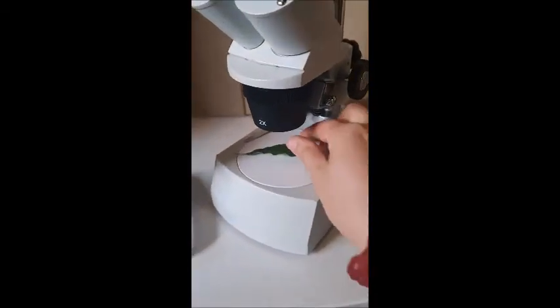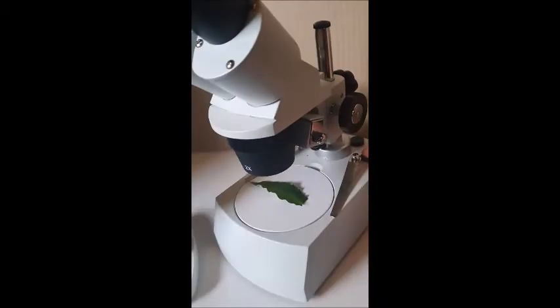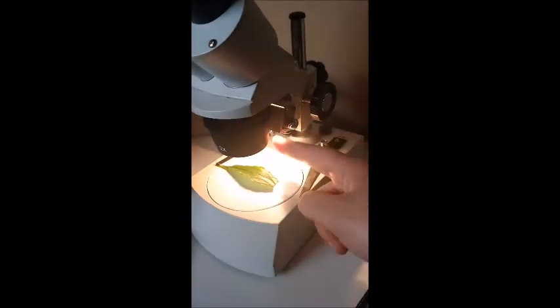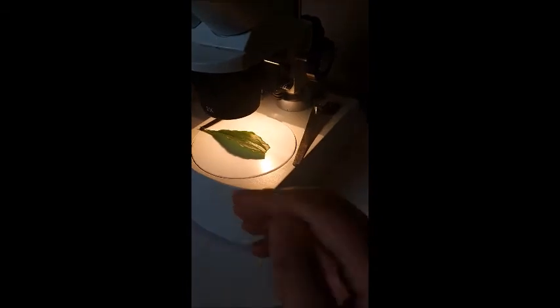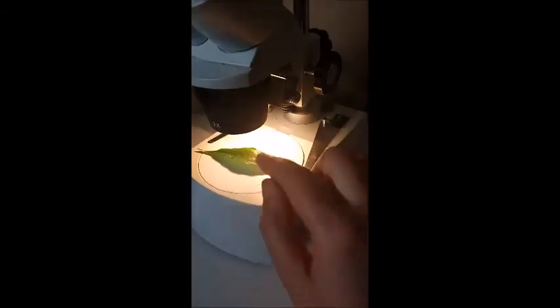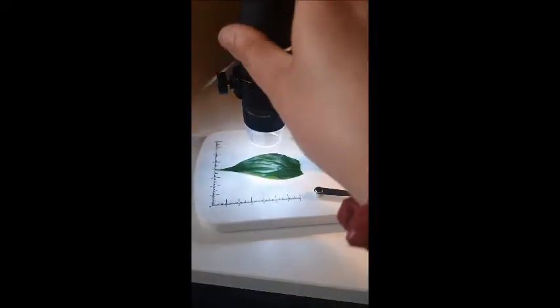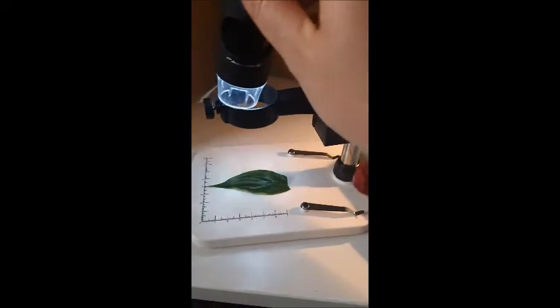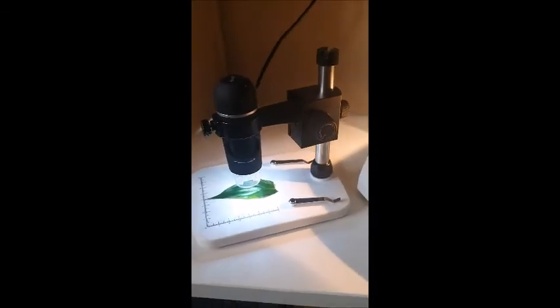All right, so I've just got this leaf from a peace lily plant. And I can't actually show you how to look through this one because I don't have a camera that goes through it. But I'll quickly turn it on for you and see how the light source is up the top. Whereas with the light microscope, the light came from the bottom and shone through it. So that's a big difference with this. Light source from the top. But what I will do is put it under this one. Again, the light source is at the top. It's actually inside that little guy. And I'll show you what this leaf looks like.